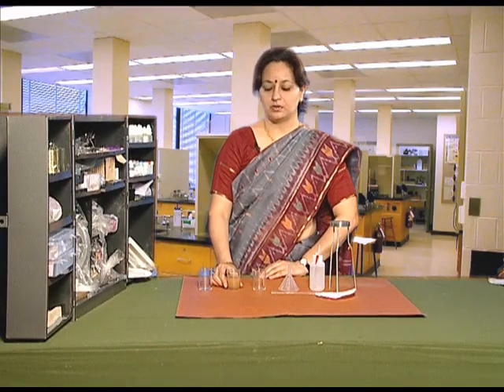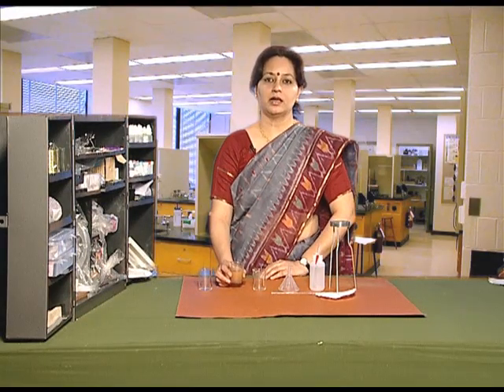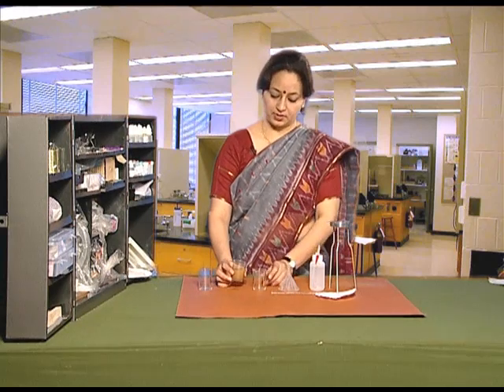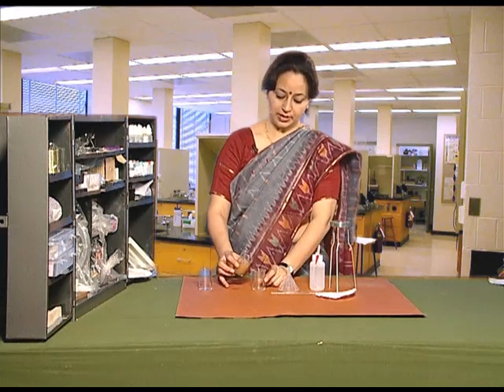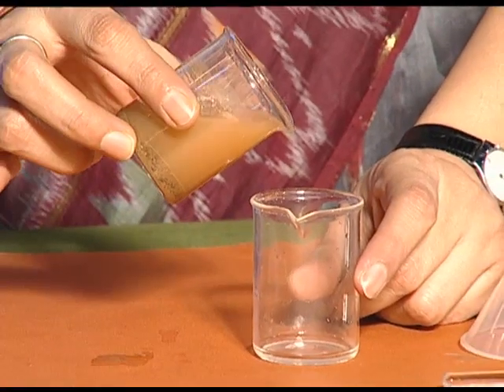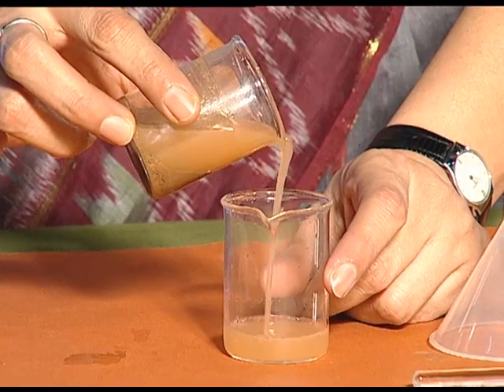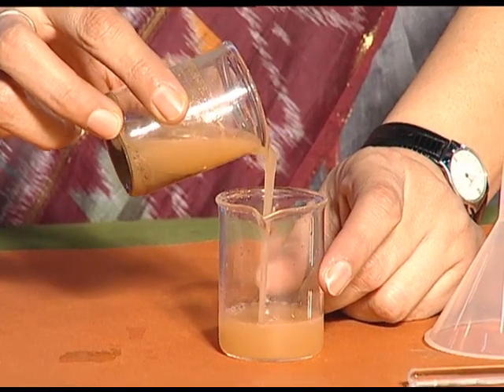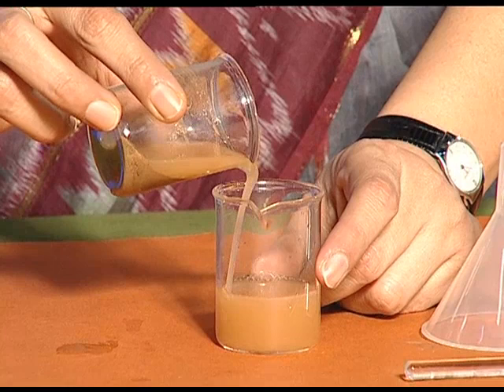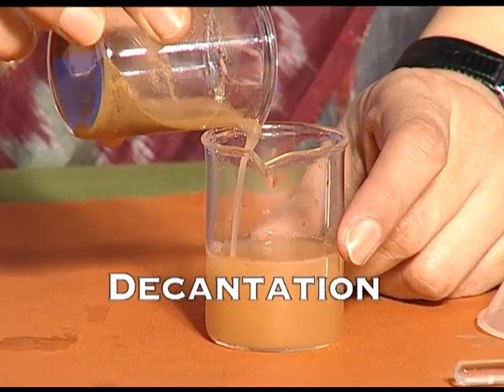Now we pour the liquid contained in the beaker into the empty beaker. This pouring of liquid into an empty beaker is called decantation.